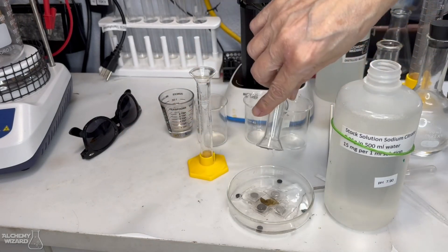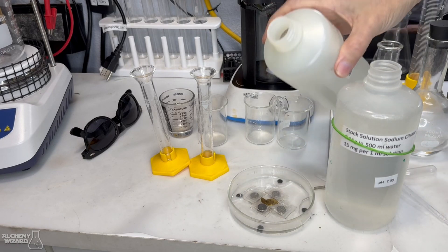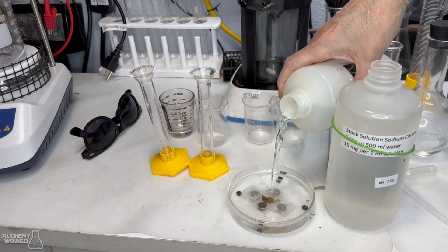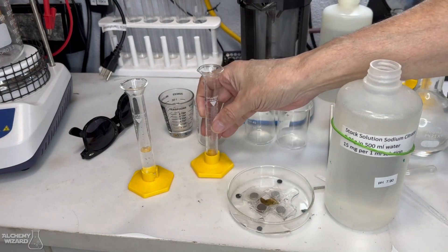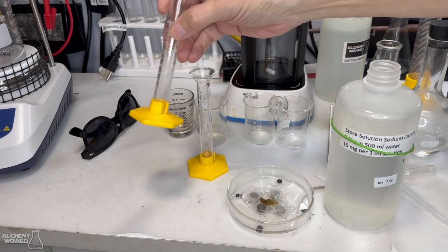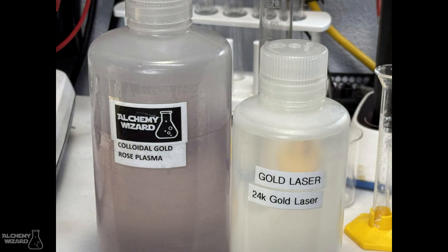We're also going to add already-made 20 nanometer silver and gold — five milliliters of each — to seed the mixture. Silver has been known in some studies to increase the chaotic quality because now we have dissimilar metals in there, so they won't combine in a symmetrical pattern as easily. The whole idea is to create these things into spiky patterns. Adding gold already in there is because once we have nanoparticles present, we tend to create new nanoparticles a lot faster, so why start from scratch?